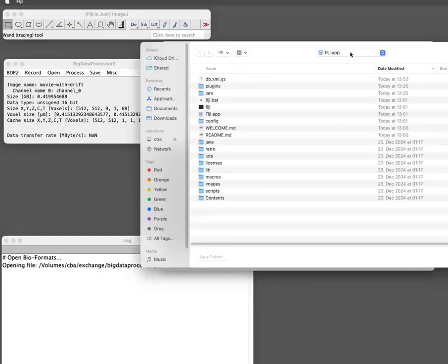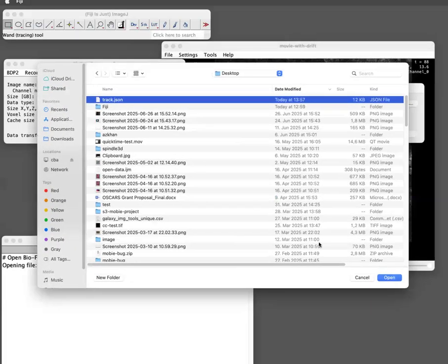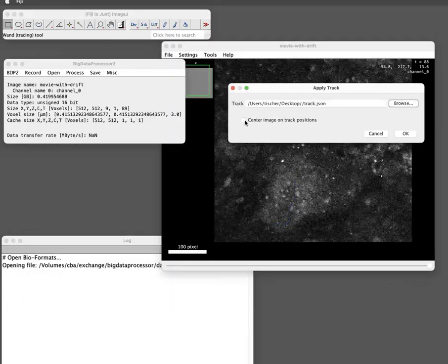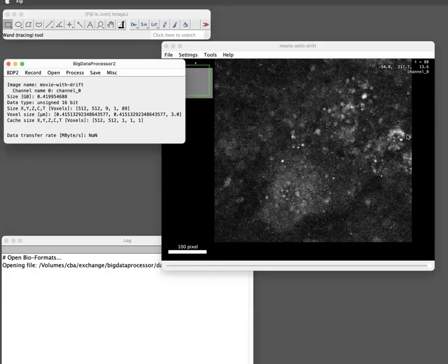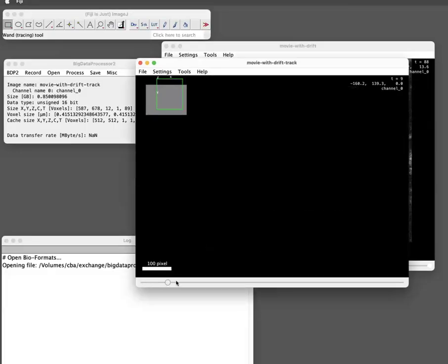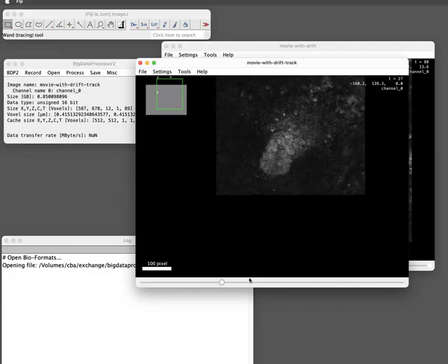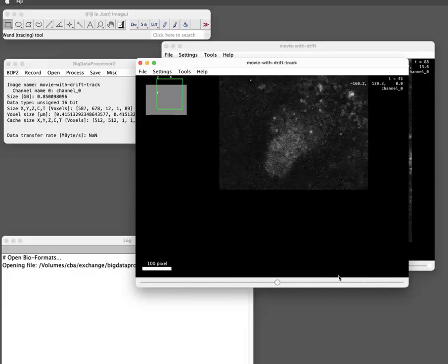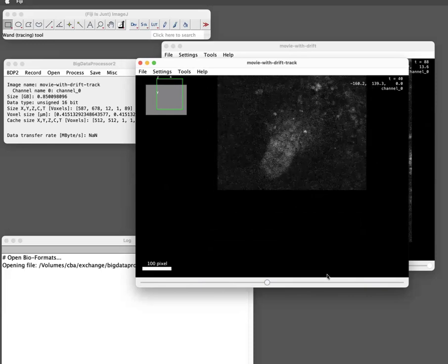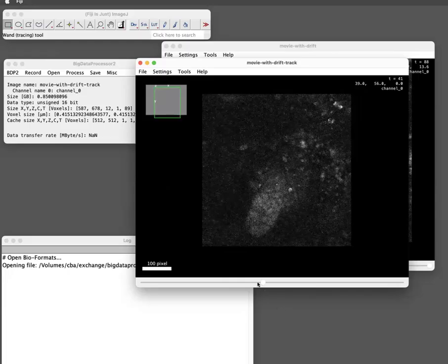load it. So desktop, and this is actually a JSON file format. That's why it's called track.json. Automatically appends the JSON ending. And then, yes, indeed, I want to now center the image on the track positions. That's the point. We want to drift correct. So now a second window opened. And if I play the movie here, you see how now it's stabilized, right? So the actual frames are moving such that the tip stays in the middle. With the right mouse button, I can center it.